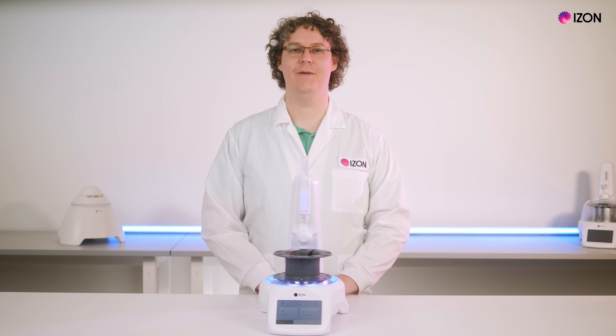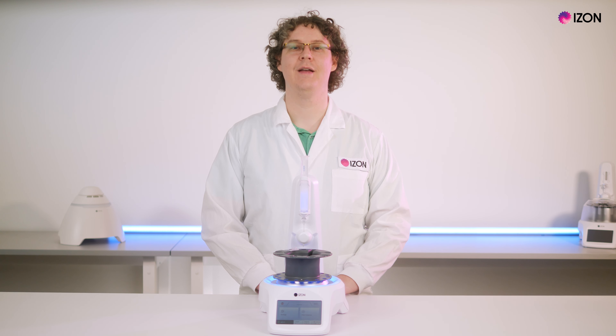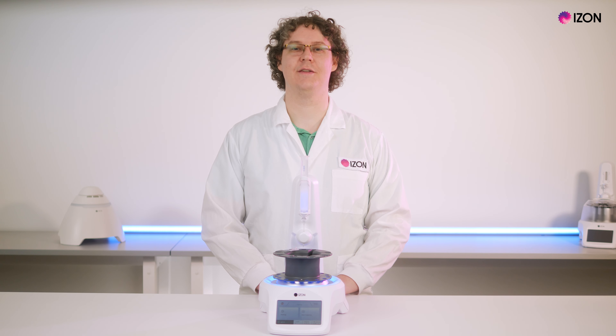The Automatic Fraction Collector, or AFC, provides an element of automation to EV isolation. After mounting your QEV column onto the AFC and loading your sample, samples are separated based on the principles of size exclusion chromatography. The sample elutes from the column into separate collection tubes, allowing you to study the components of your sample that have eluted in separate fractions.